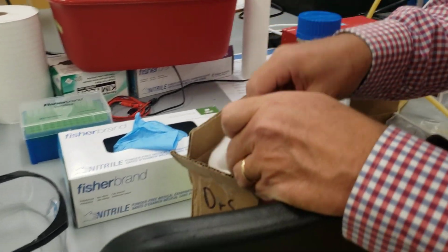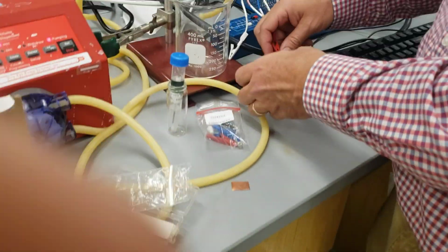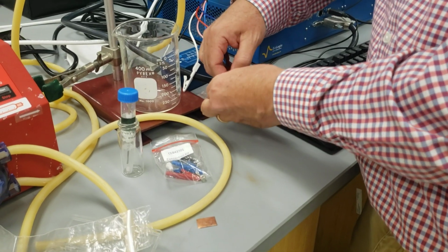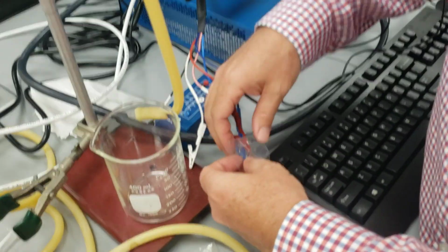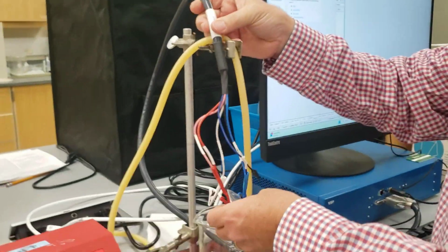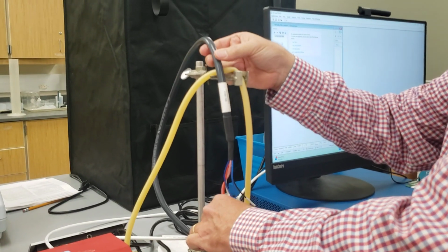This is an example of the magnet. This wouldn't need to be the exact magnet we use, but this one should be fine. See how it makes a nice good seal like that? So we're going to clamp this onto the electrode there, and then use this magnet to get a good seal. This cable right here can rest on top of this, and that way we can get it to be as long as we want. So we have the working electrode there.